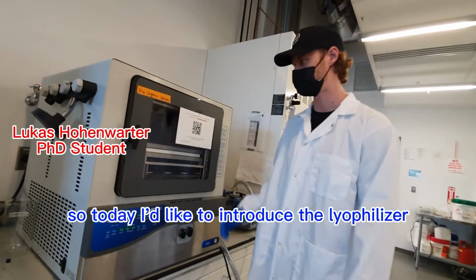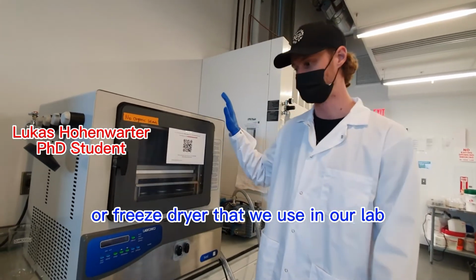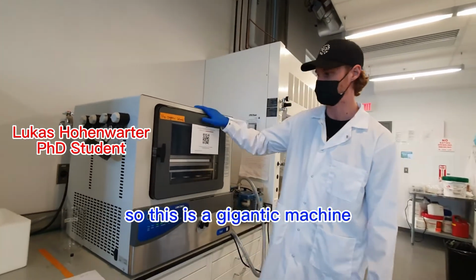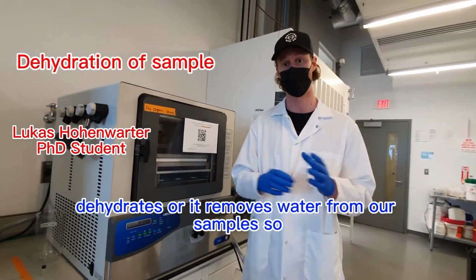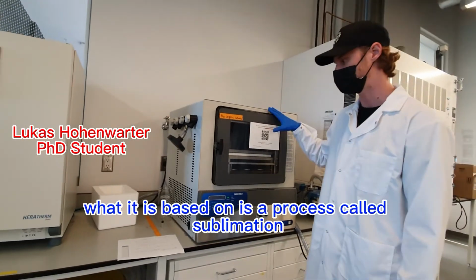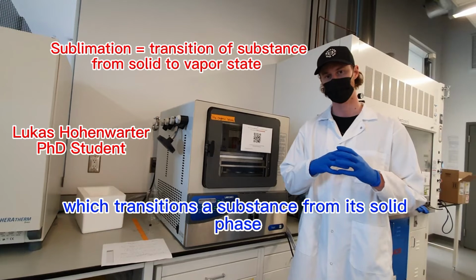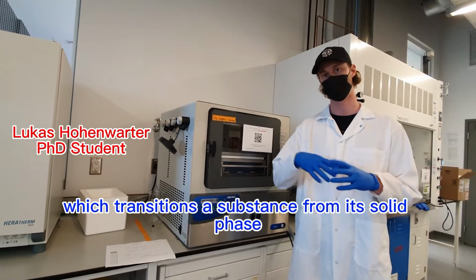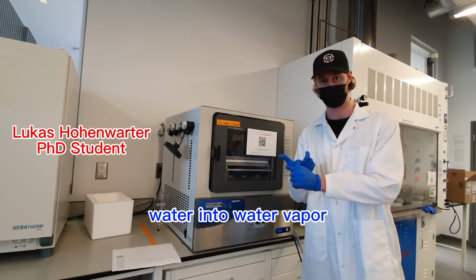Hey everybody, today I'd like to introduce the lyophilizer or freeze dryer that we use in our lab. This is a gigantic machine, but what it essentially does is it dehydrates or removes water from our samples. It is based on a process called sublimation, which transitions a substance from its solid phase into a vapor phase, or in our case, water into water vapor.